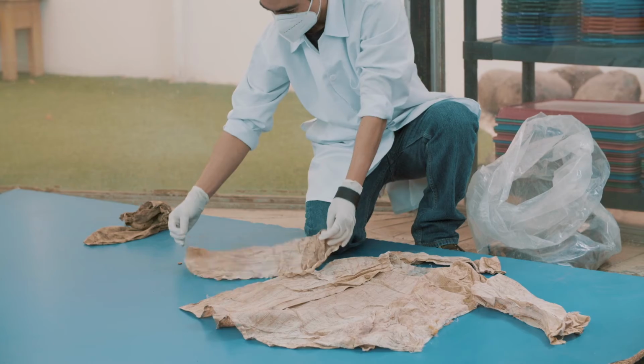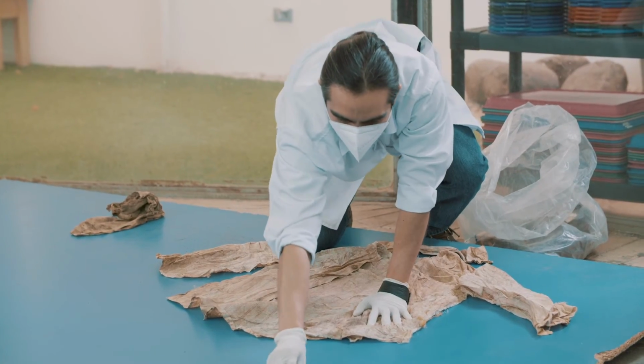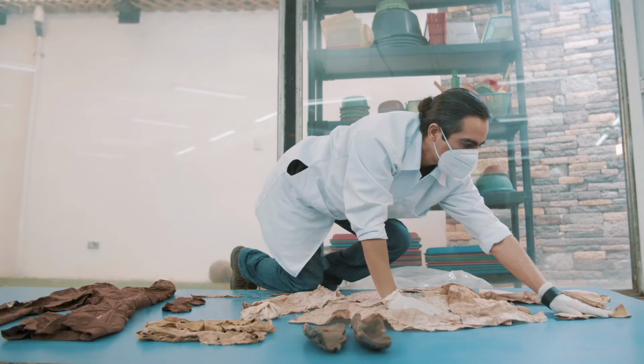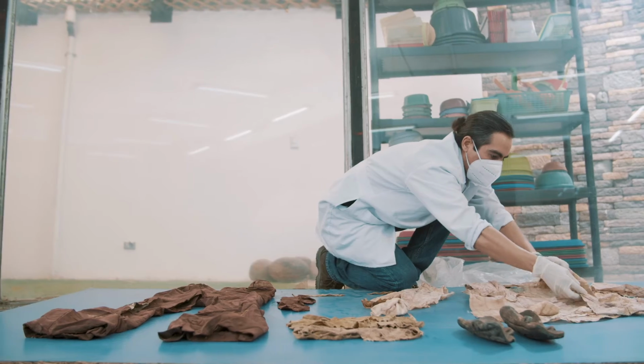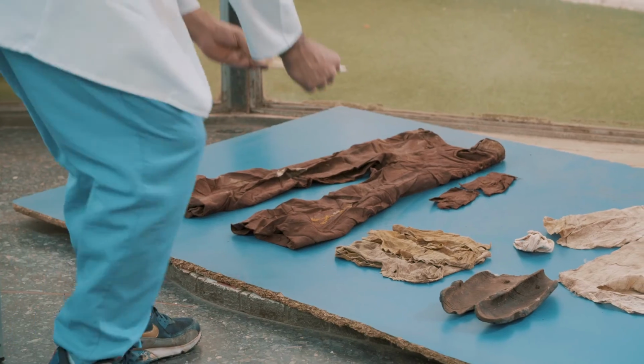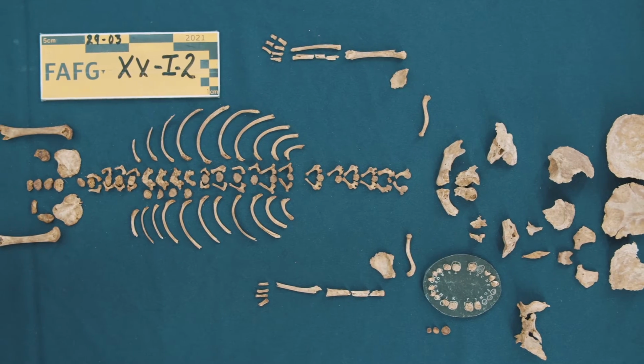The visual record includes photographs from the pre-washing stage, of the spread out skeleton, and of the study, which includes the skeleton's clothing, associated items, protective materials, dental records, biological profile, individualizing features, circumortem trauma, and skeletal samples.